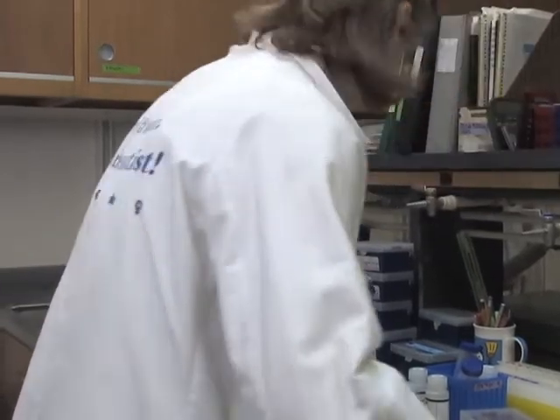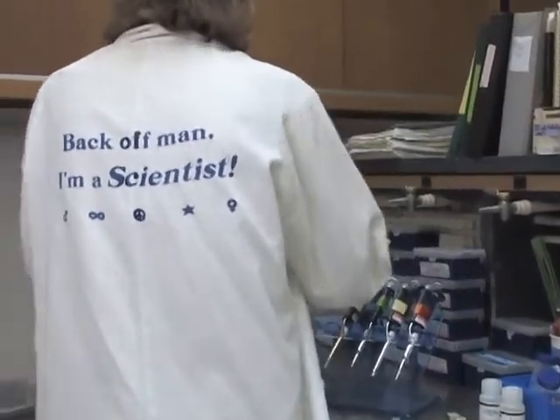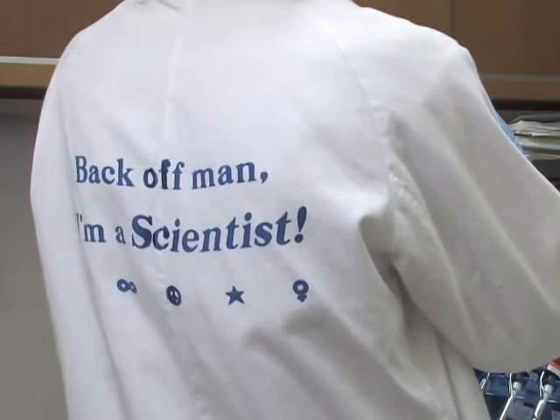And we use kits to do that, and we extract the DNA, and then we can use that purified DNA in our either PCR or qPCR reactions. Like regular PCR, qPCR also copies DNA, but it allows us to watch the cycles of DNA replication in real time to see how much C. shasta DNA is present.